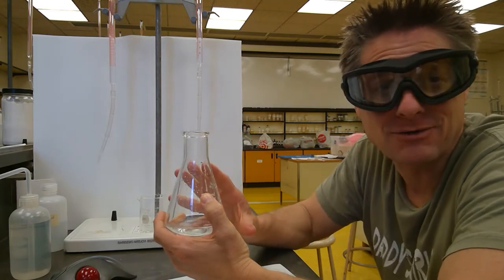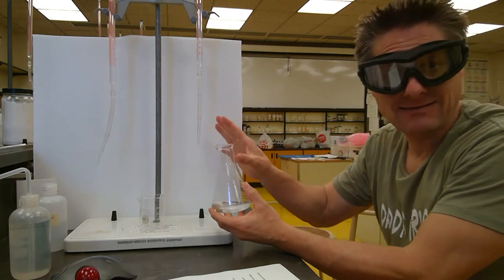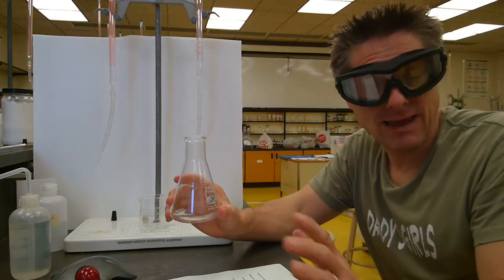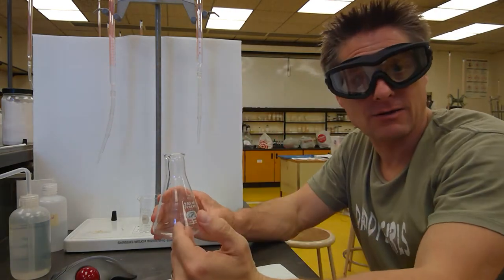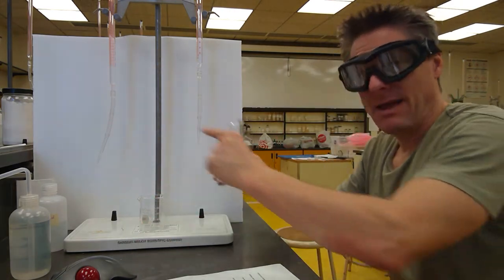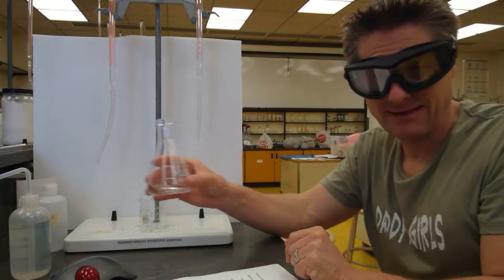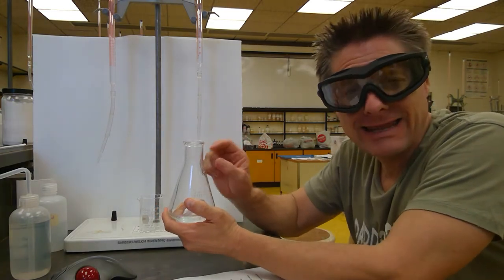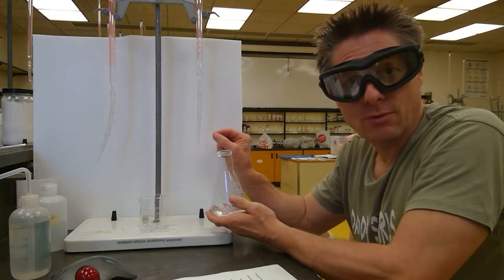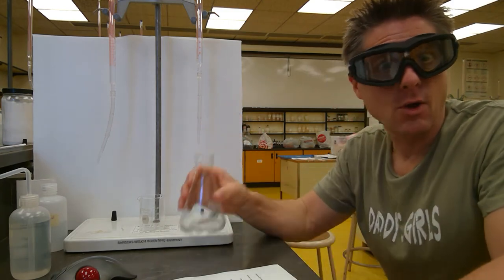I'll tell you, it's okay for introductory high school chemistry. Here, I'm just going to go boom, as fast as I can, turn it that pink color, and then I'm going to add some more acid and turn it colorless again and back titrate it. And then I'll go back and forth from the base to the back titrant acid, getting a fainter shade of pink each time until I can literally get maybe a half to a quarter of a drop tapped off into here and get the faintest pink color possible.